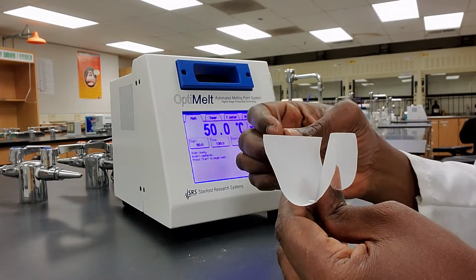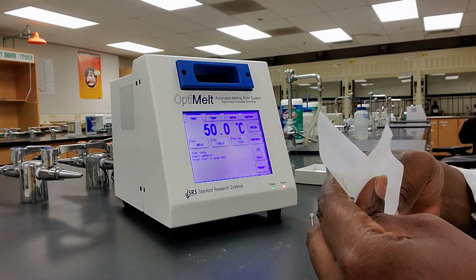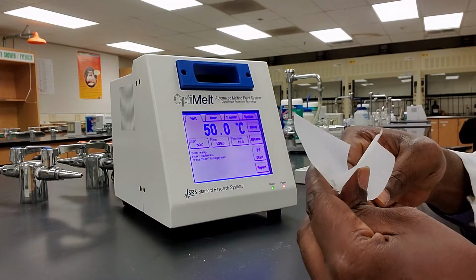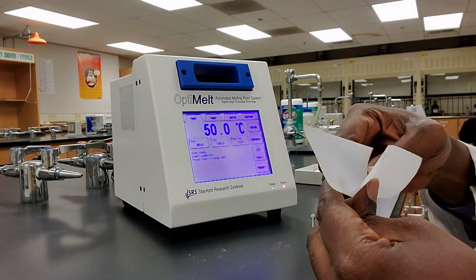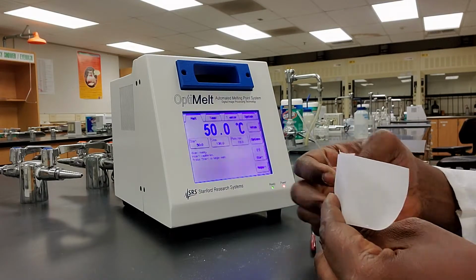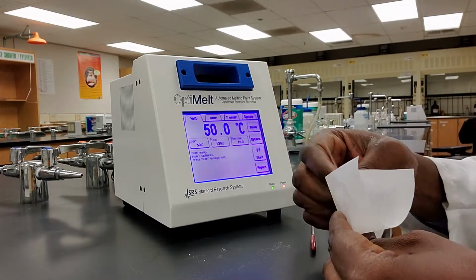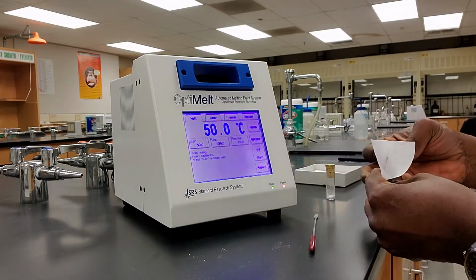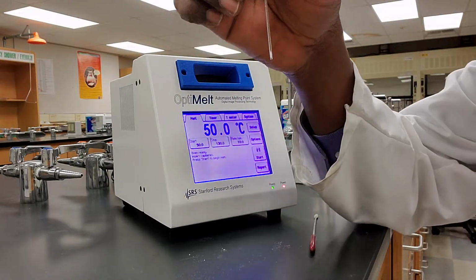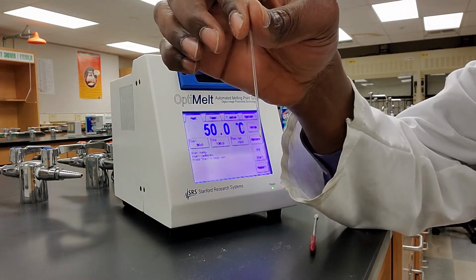capillary tube. Once I guide the sample, I'm going to tap it on the bench, guide it some more, tap it on the bench, guide it some more, and tap it on the bench like so. Okay, now when I'm done doing this, you'll see that I have been able to successfully put about 1/8 of the sample, of the solid sample, into the capillary tube.